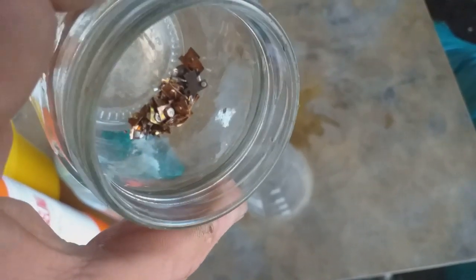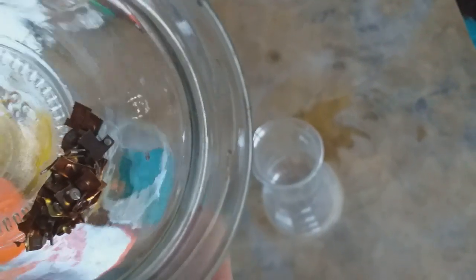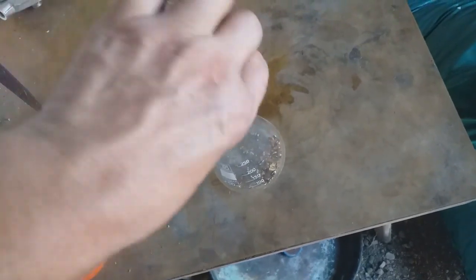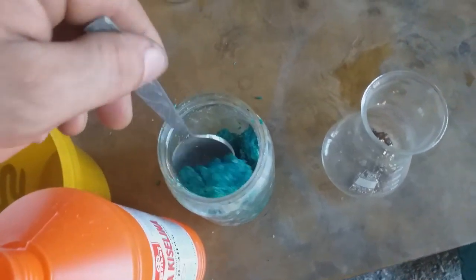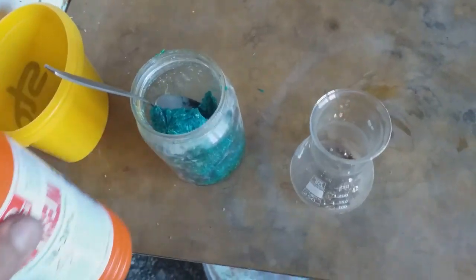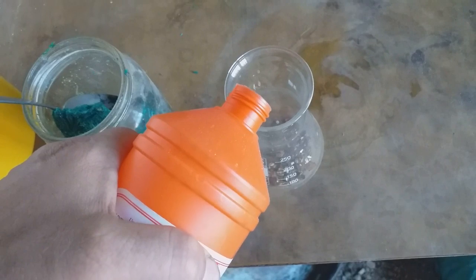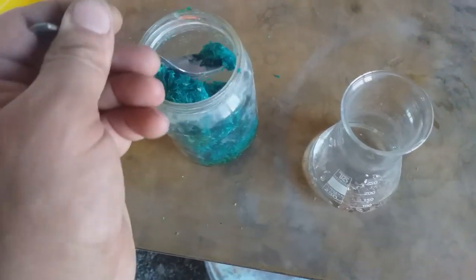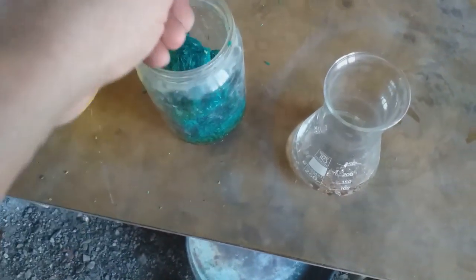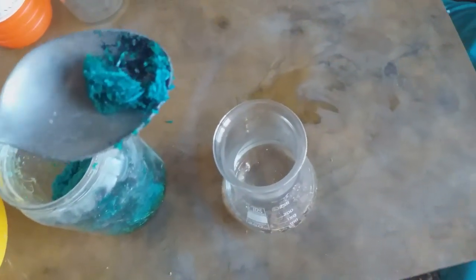Just for the purpose of the video, I have some silver contacts and I want to remove all the copper and the nickel base. I put that in a beaker and I will use some amount of hydrochloric acid — I put it inside, trying to catch only a small piece of that crystal.